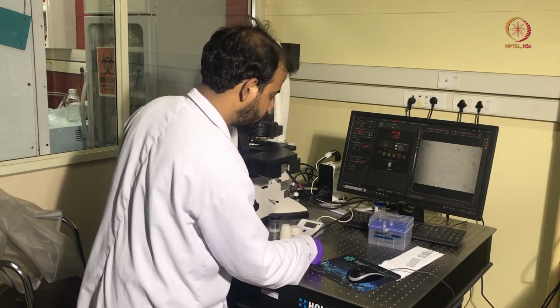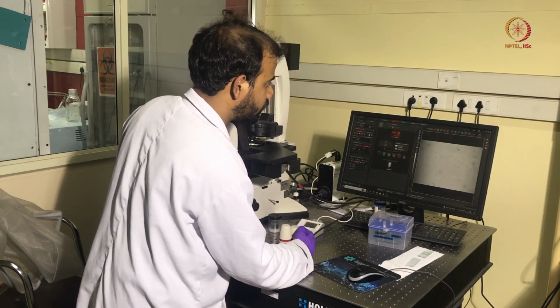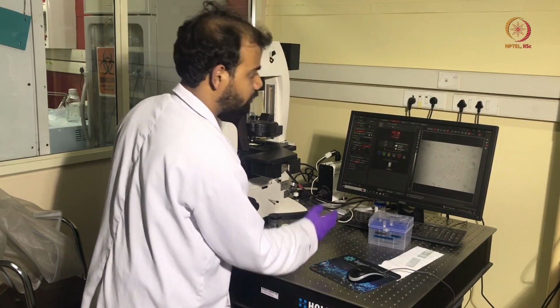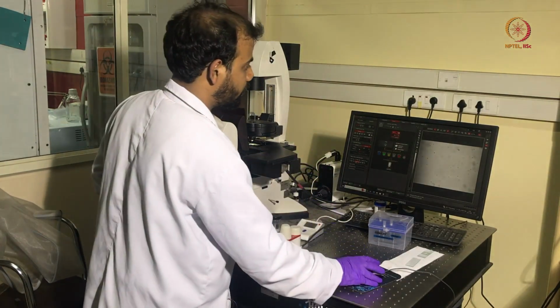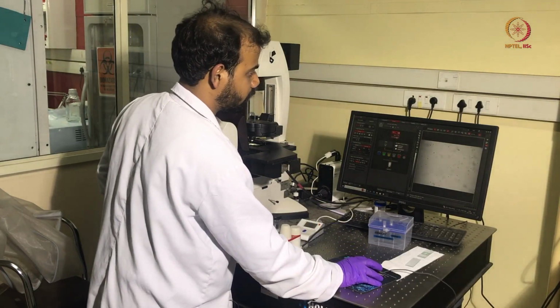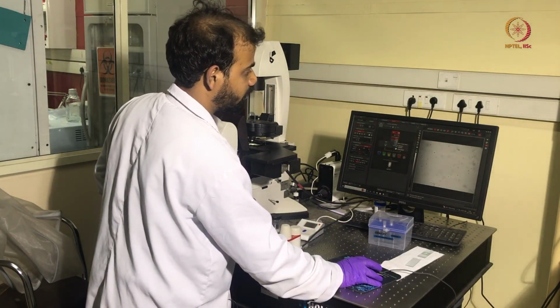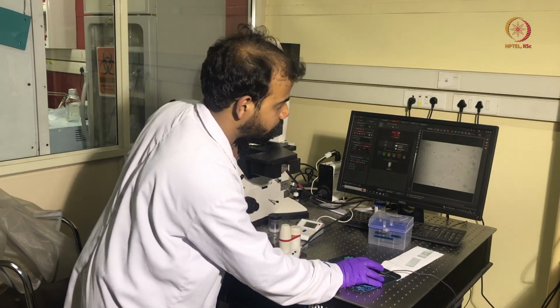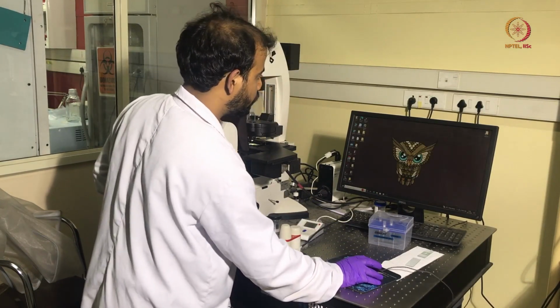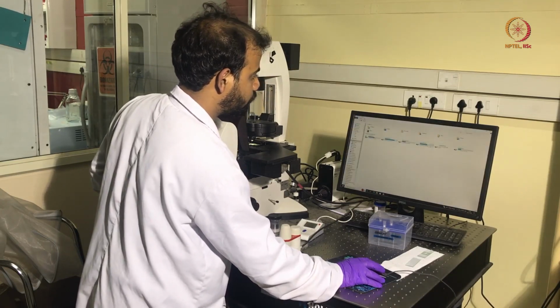Again we will adjust the z-axis a little bit. Now you can see the Brownian particles undergoing Brownian motion, and here we have different modes in addition to the bright field, dark field and fluorescent. We have already recorded the videos of this Brownian motion, and we will show them now.